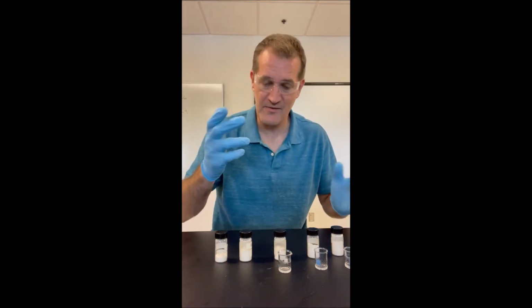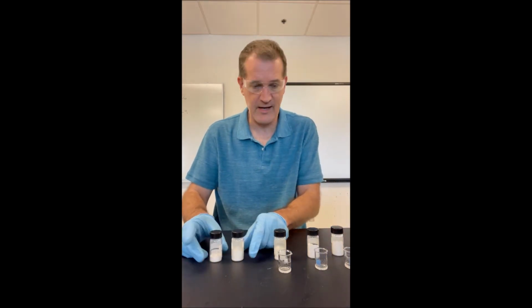This is an intro video for Chemistry 1152 TLC lab. TLC, in case you guys are wondering, stands for thin layer chromatography, not tender loving care. There won't be any of that in this lab.